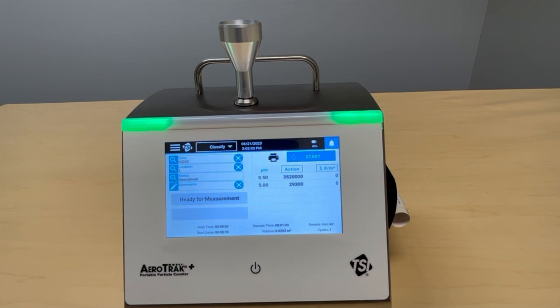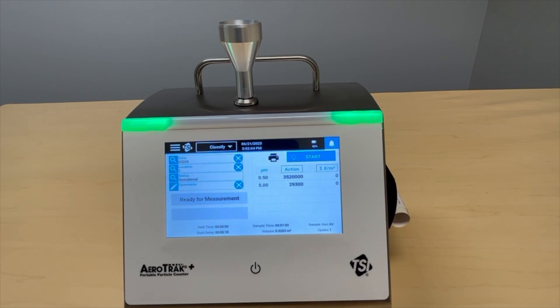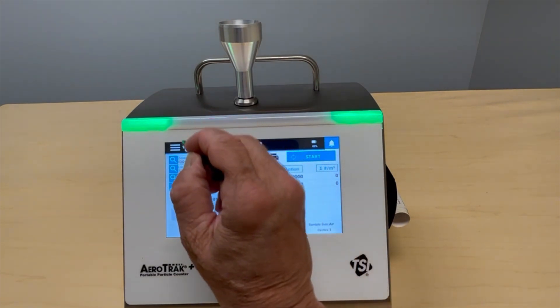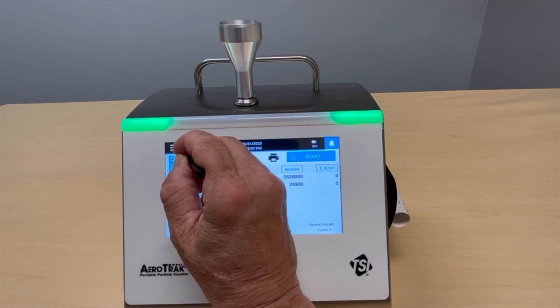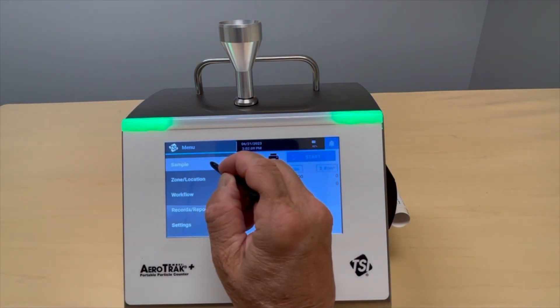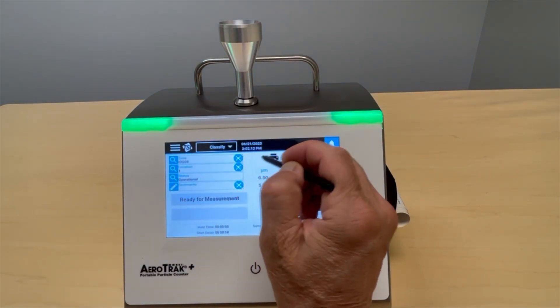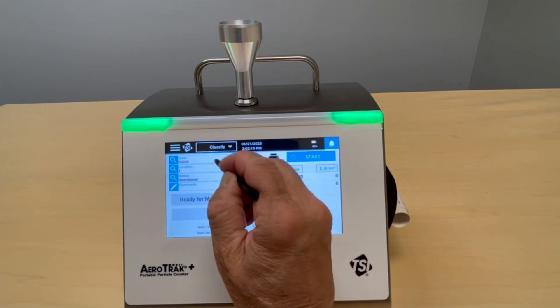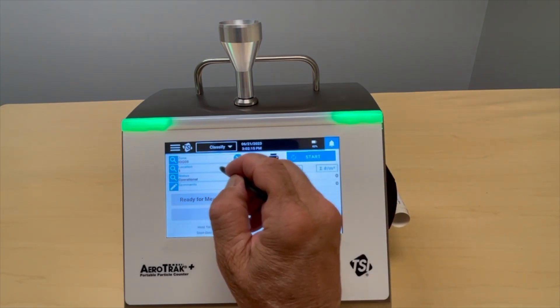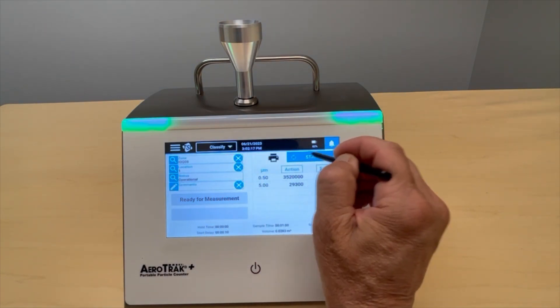Hi, it's Mike with TSI. Today we're going to take a quick sample in the classification mode with the new Aerotrack Plus A100. All we have to do is make sure we're in sample mode, make sure we're in classification sample mode, make sure we've got the right zone pulled in and location, and click start.